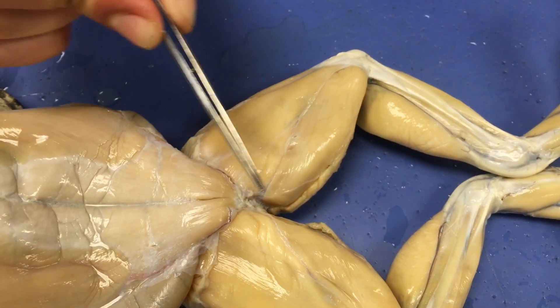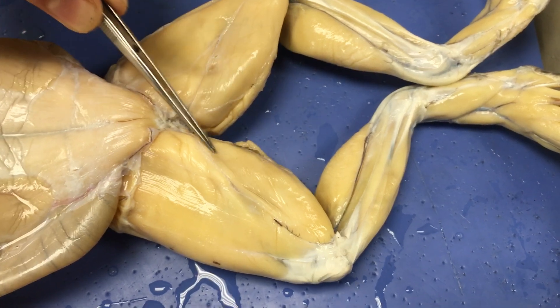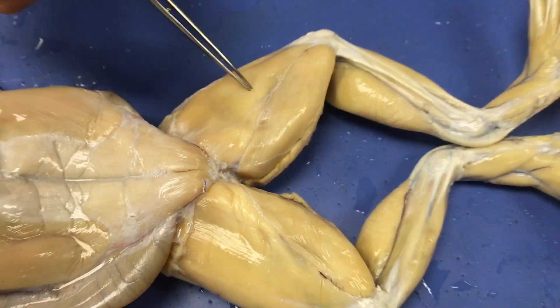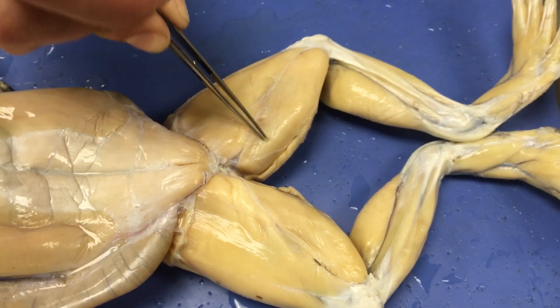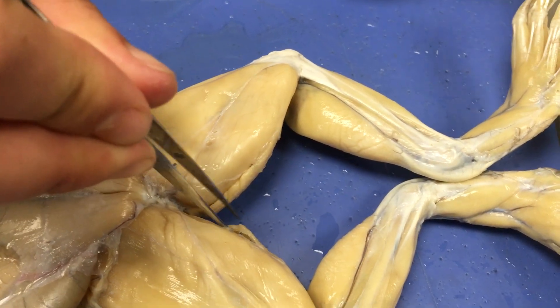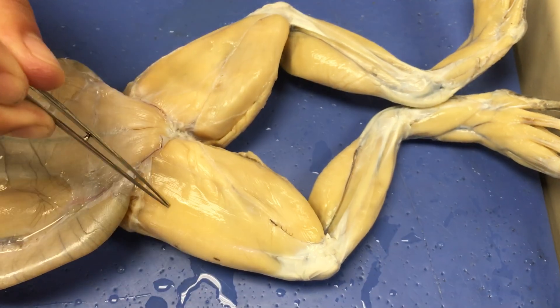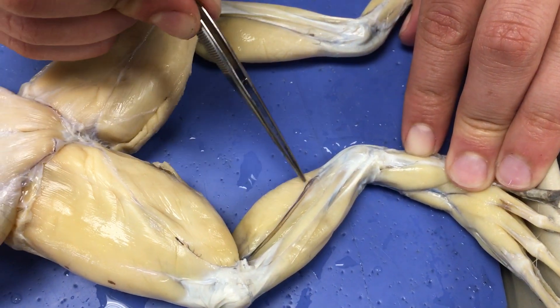I like to remember the acronym GAS — think about the frog farting from the cloaca. So we have the gracilis major, the adductor magnus — this kind of fine triangle in here — and then on the outside, the sartorius. We also have a thinner muscle on the very outside of the leg called the gracilis minor. So: gracilis minor, gracilis major, adductor magnus, and sartorius. Our final muscle, associated with the Achilles tendon, is the gastrocnemius.